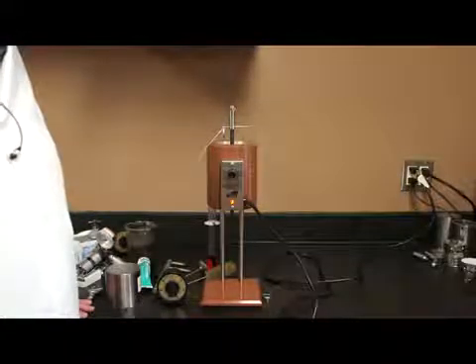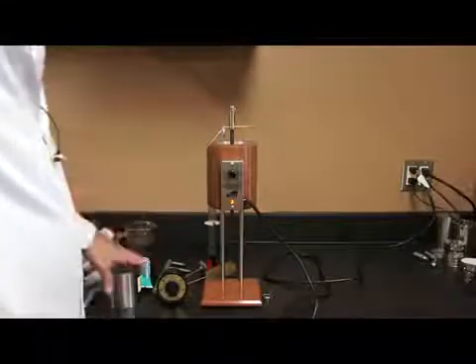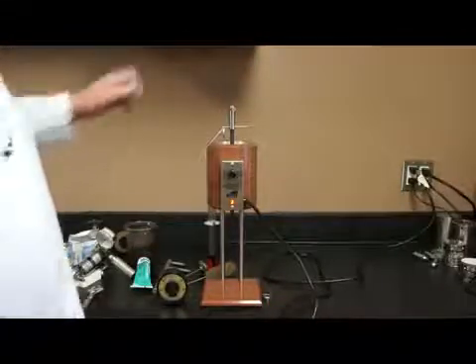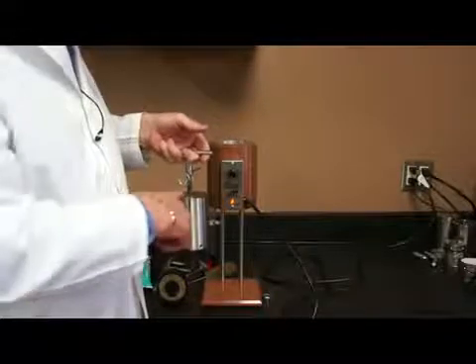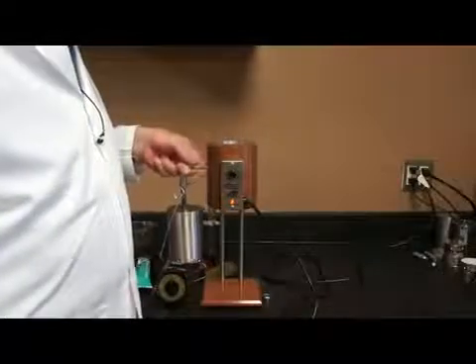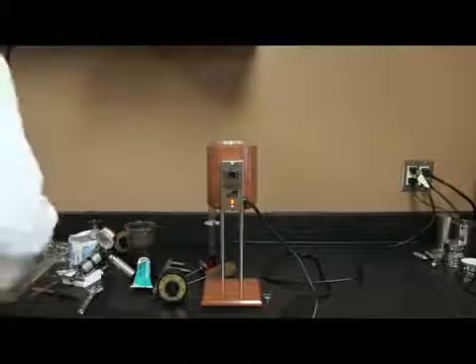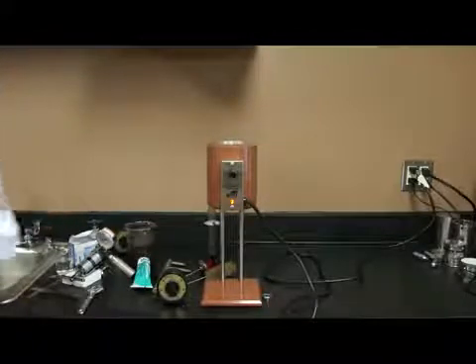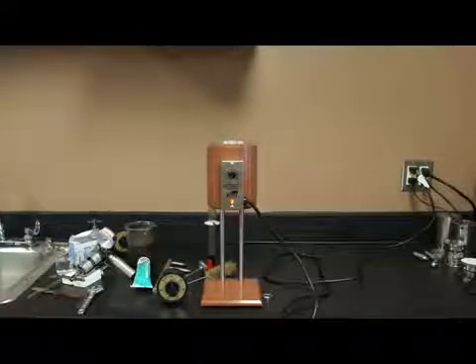So I would recommend go ahead and using water, but be very careful when you pick this up. I'm going to put my filter press cell body in the sink, and I'm going to run cold water over it until this cools up. I'm going to maintain this in an upright position because I have my filter cake on the bottom, and I will place this in the sink and let it cool down with water. And I'm going to turn the video off and come back, and we'll do the cell disassembly in a few minutes.